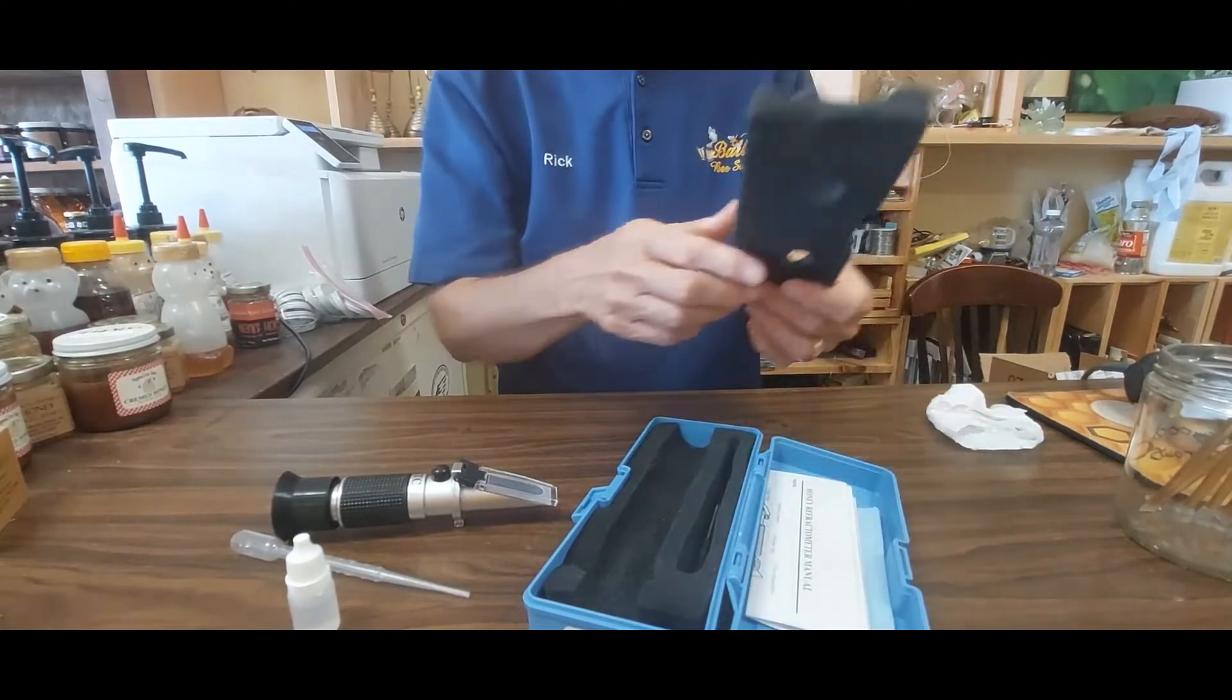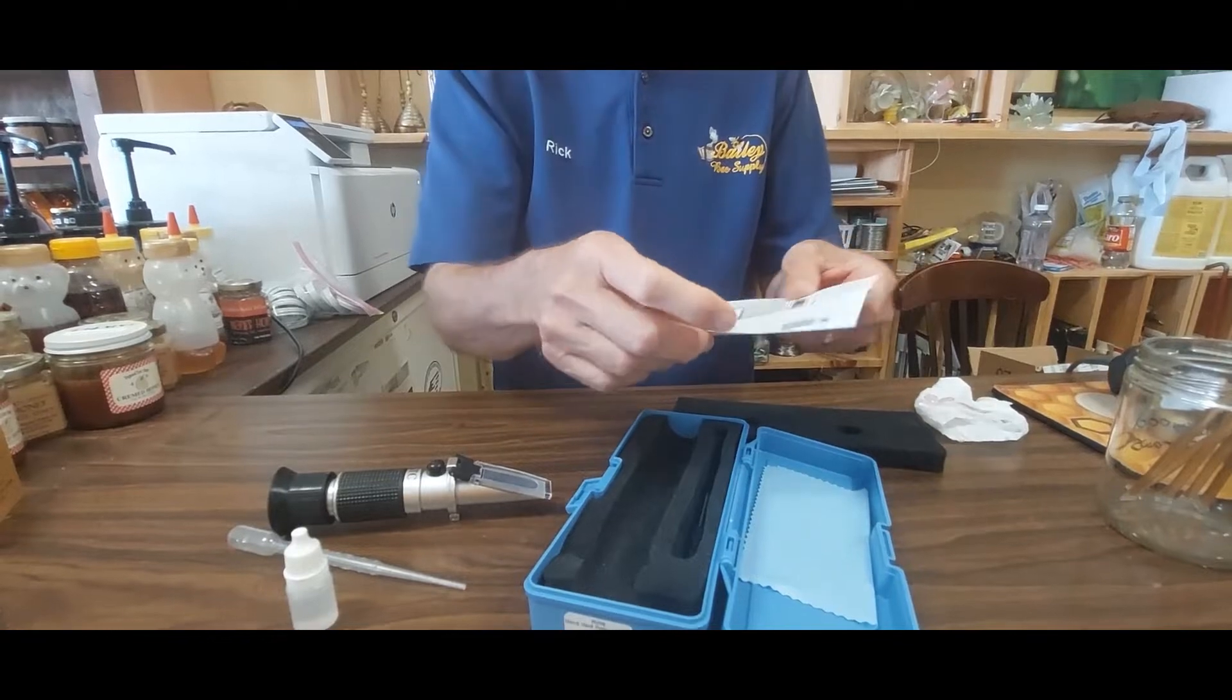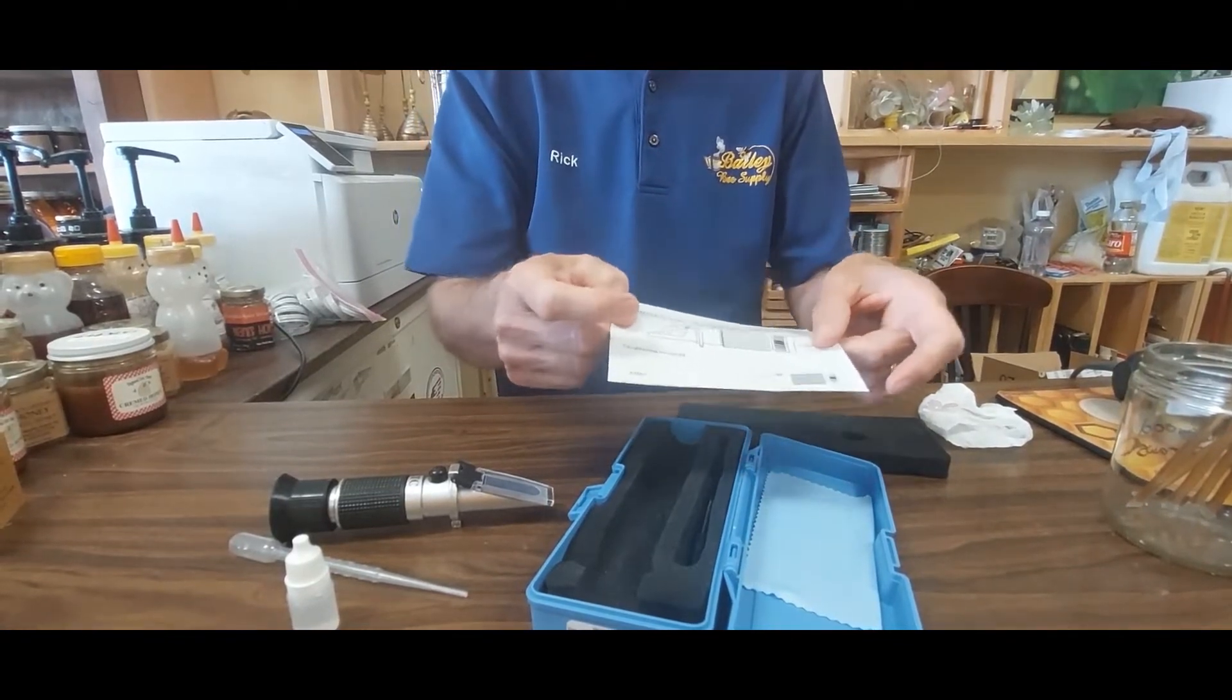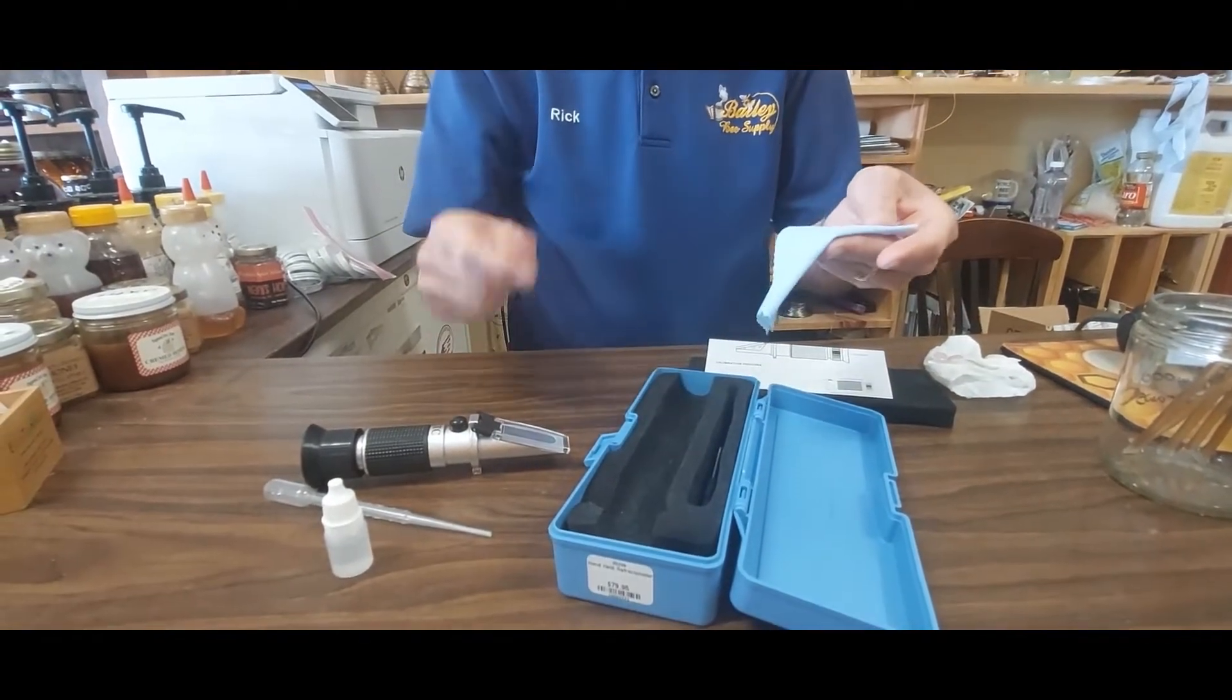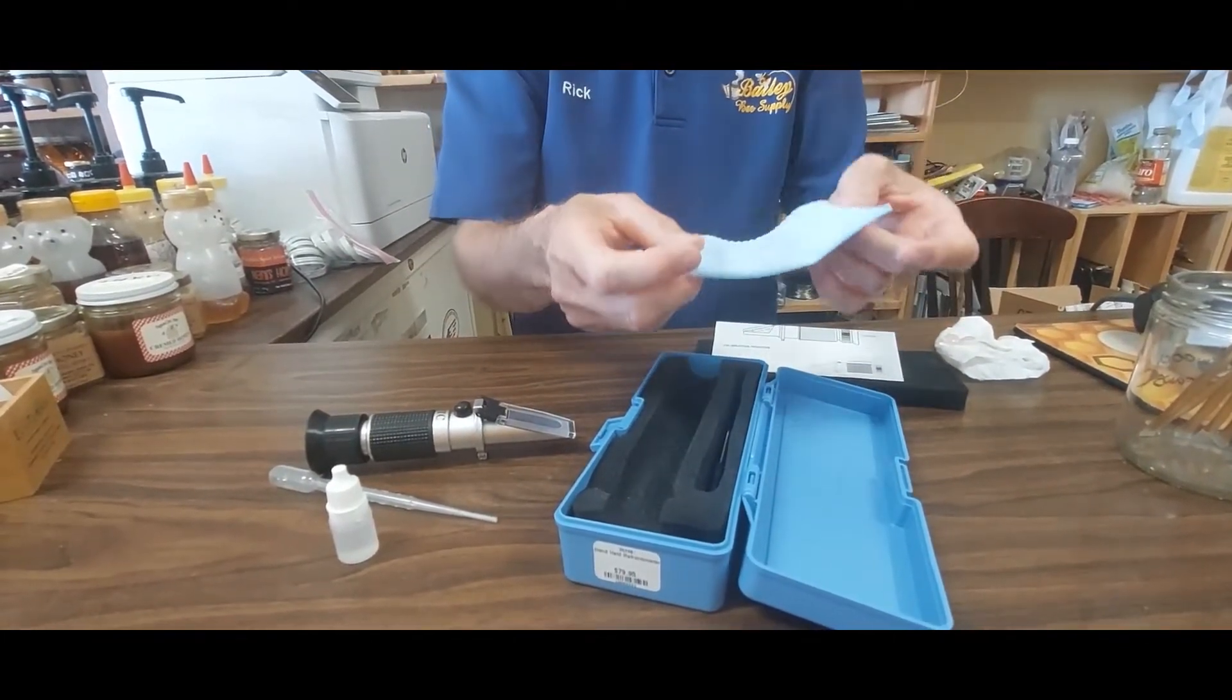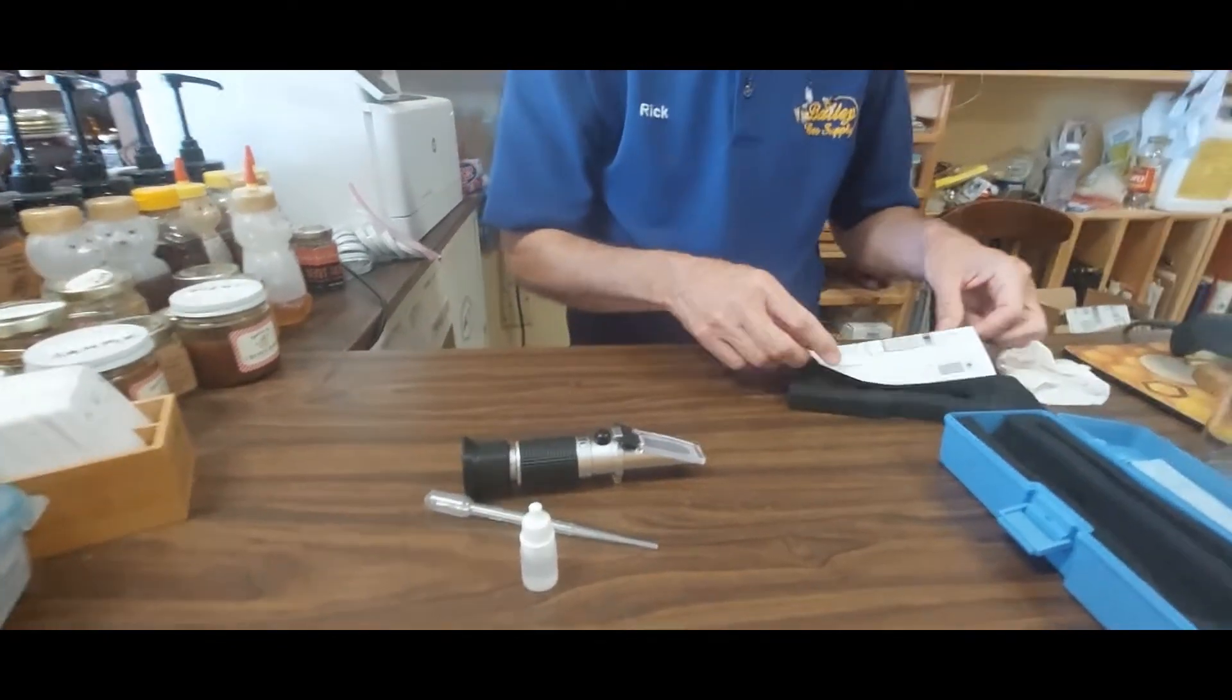And the top, just remove that foam, and there are instructions on how to calibrate the refractometer and a wipe that you can clean the refractometer with after you clean the sample off. So let me set these aside.